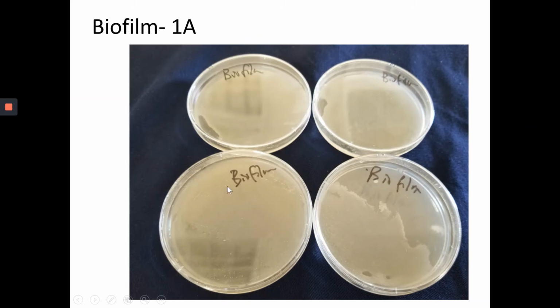This one is okay. Definitely this is the perfect one. There's some edge that you cannot use, but generally speaking, we place our paper disc in the center, so that should be fine. You can still use this plate. And this one you can still use, maybe only half a plate though.